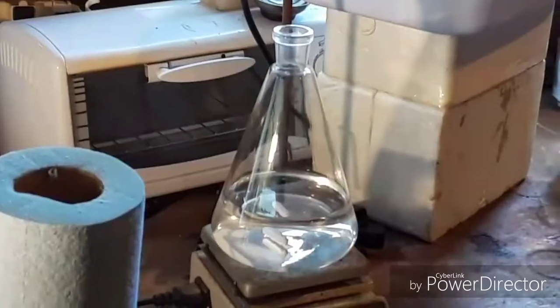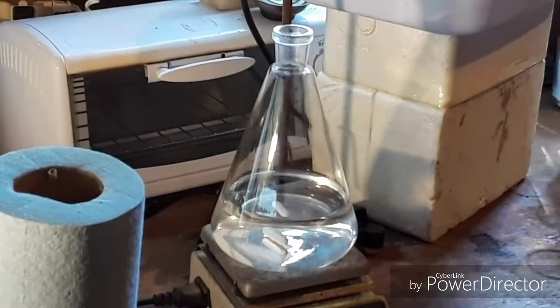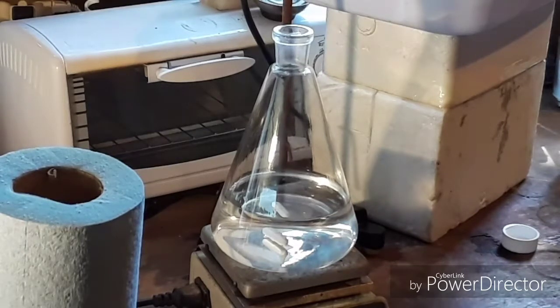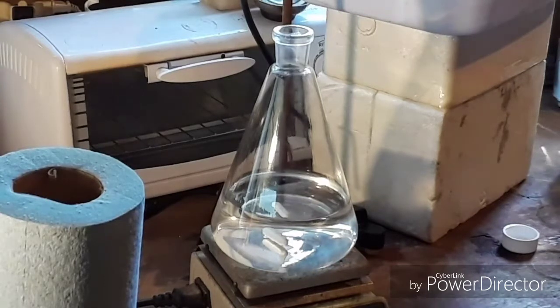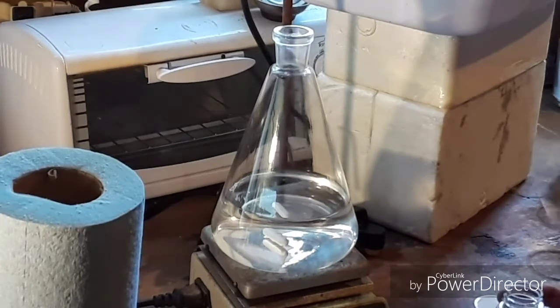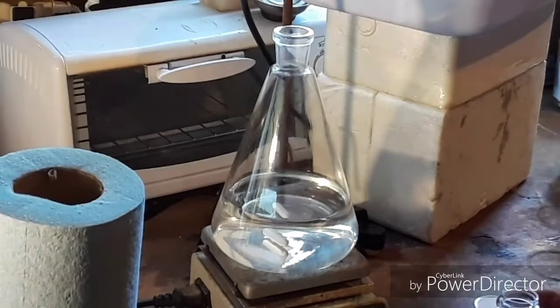Let me get some tablets in here and then we will turn on the stirring. I'm going to start adding some tablets here. I am not even bothering to wear gloves, because we are just dealing with aspirin, which in its pill form is a rather innocuous substance. The denatured alcohol is not toxic unless it is ingested. So since I am not dealing with any toxic chemicals today, I am not wearing gloves. Now what I recommend is to actually crush the aspirin tablets first into a powder using either a coffee grinder or a pestle and mortar — but it can be done without crushing them. I am going to demonstrate how it works without crushing them, in case you do not have access to a coffee grinder or a pestle and mortar.